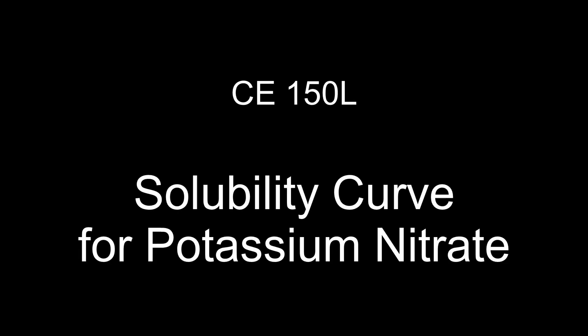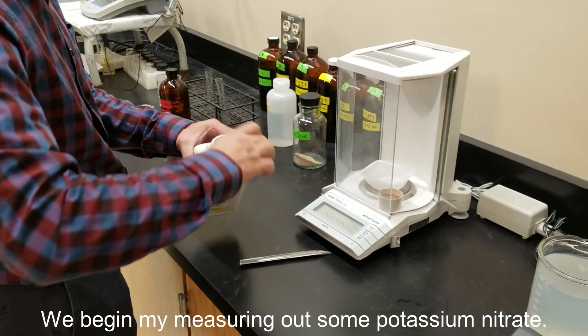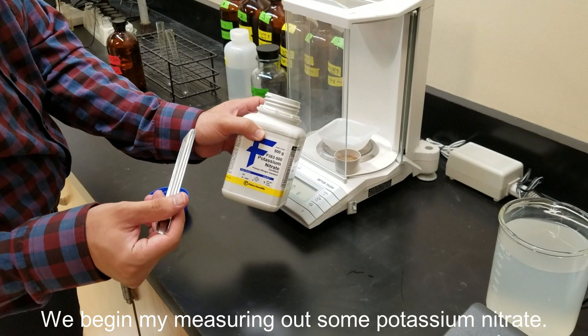In this experiment we'll be developing a solubility curve for potassium nitrate. The curve will measure solubility against temperature.